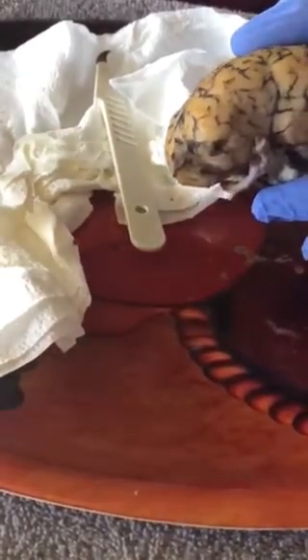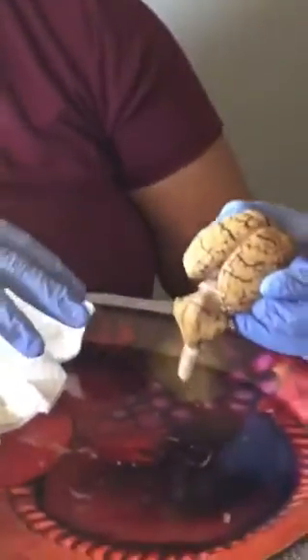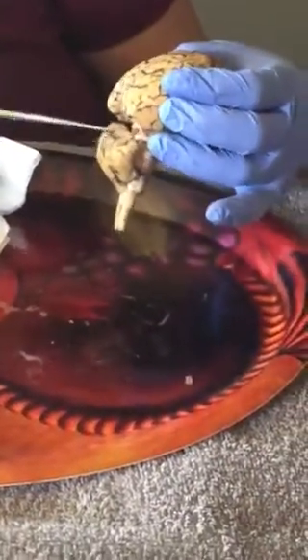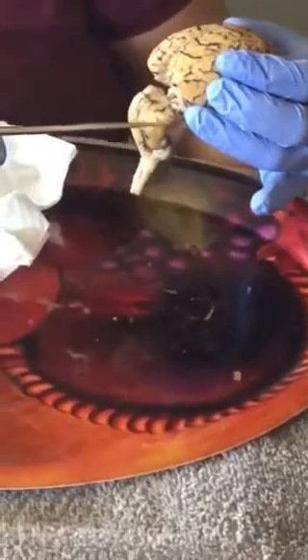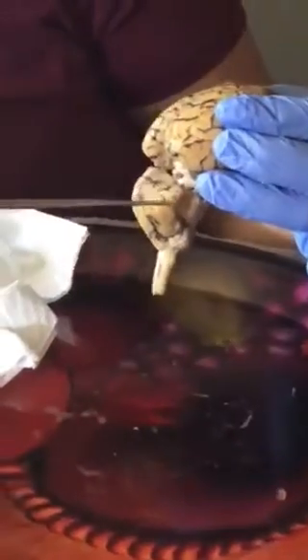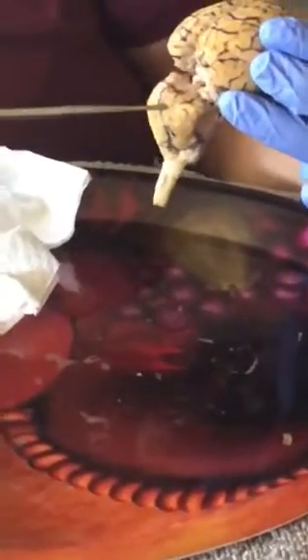So the pons is back here. This is probably the best view we can get, and I'm going to use my pointer here. So the pons is, I want to say, this part here, and then right below it we have the medulla oblongata. So the pons is the top of this. This is the cerebellum, but it's the top in the corner of it, and then the medulla oblongata is right under that.